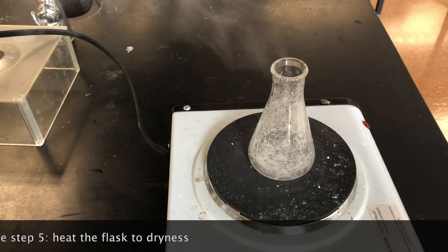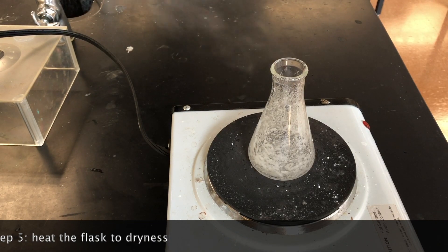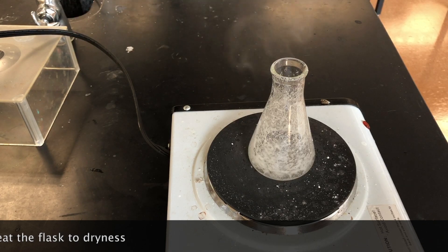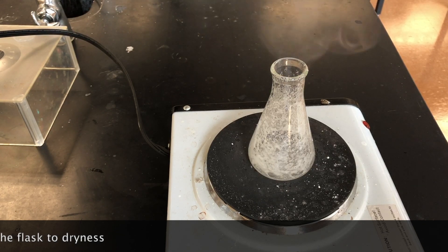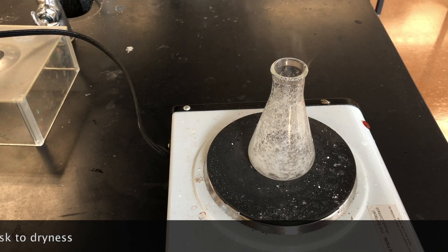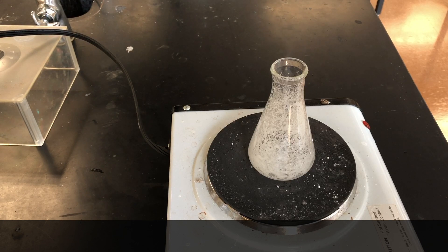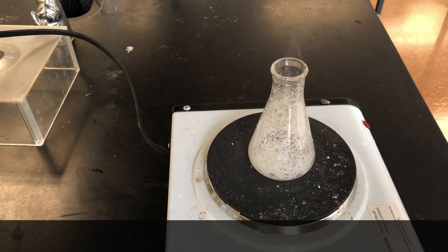The evaporation is almost complete. We're at the popcorn stage right now. We will continue the evaporation until no more steam comes out of the Erlenmeyer flask. When the steam stops coming out completely, then we know that we have gotten rid of all of the water.